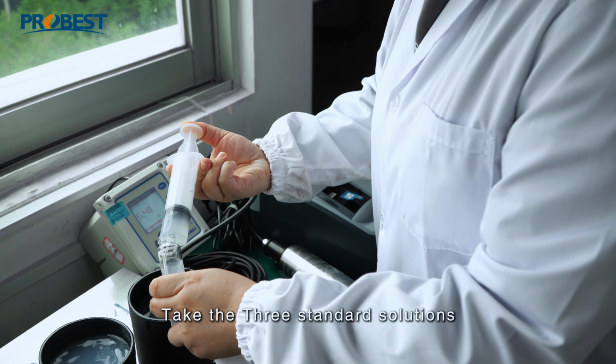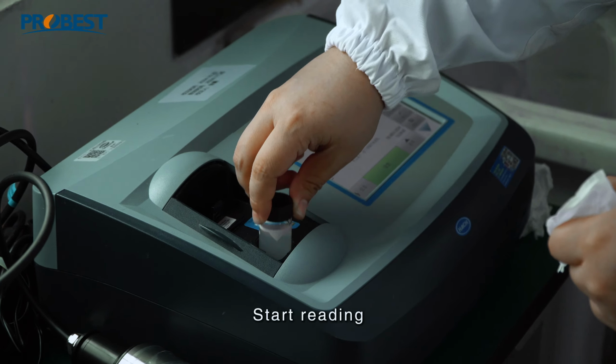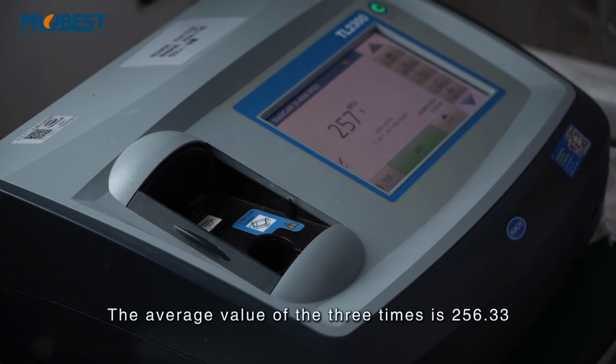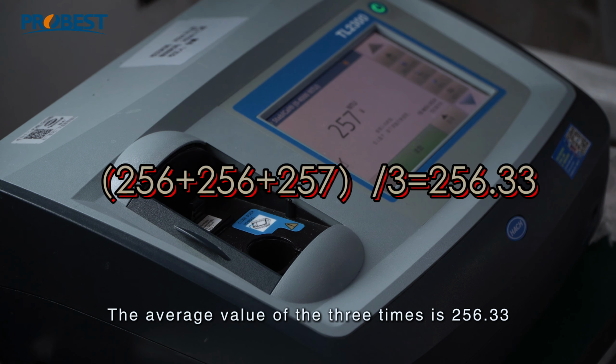Take the 3 standard solutions. Start reading. The third reading result is 257 NTU. The average value of the 3 times is 256.33.